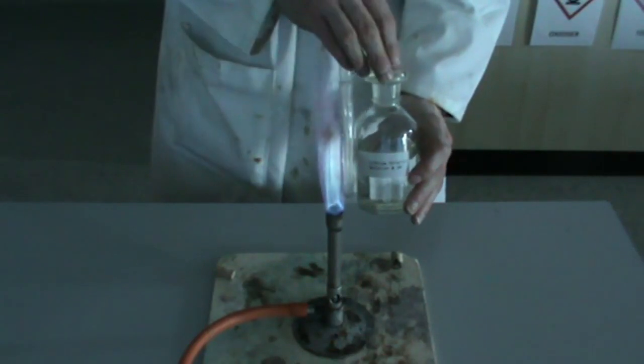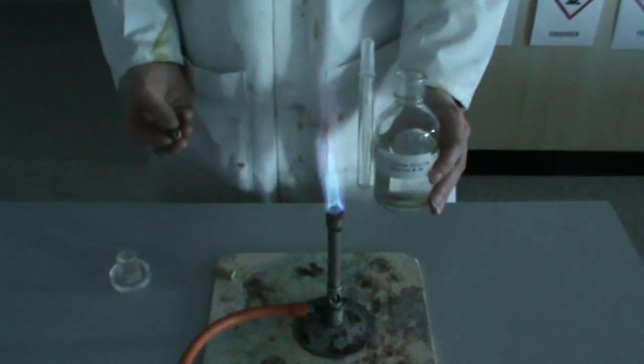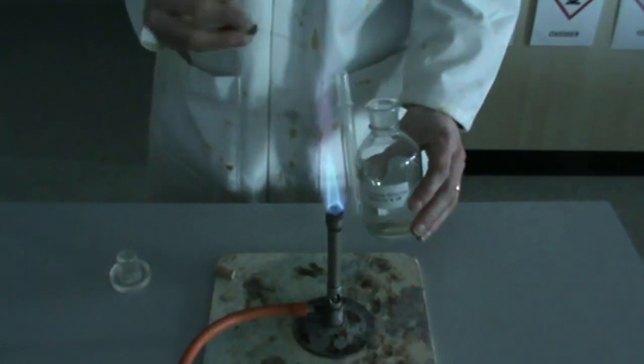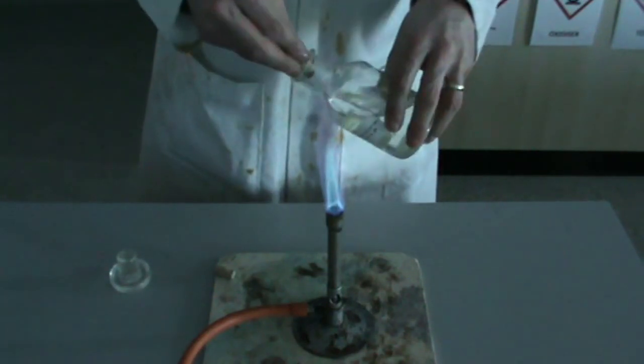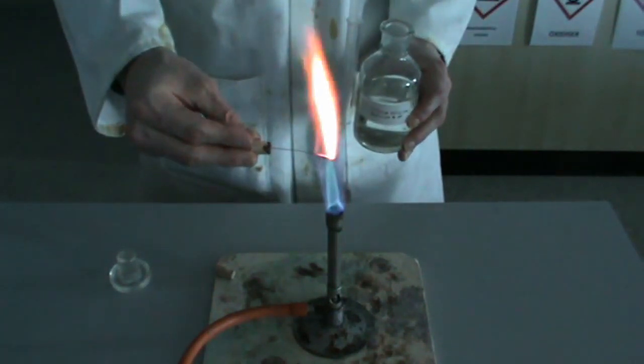Next, lithium chloride. Once again, the chloride ion plays no role. Nice red.